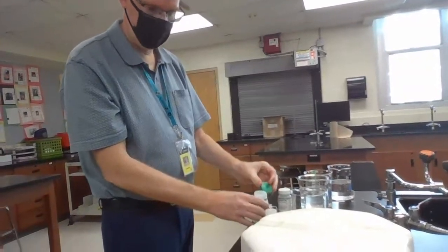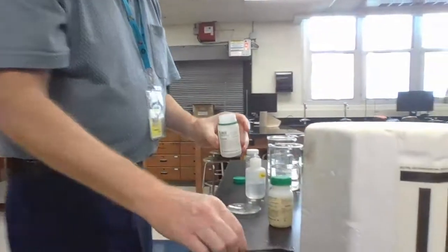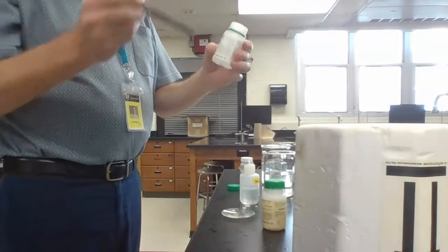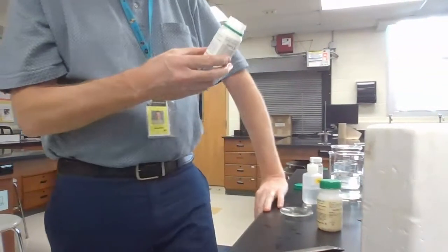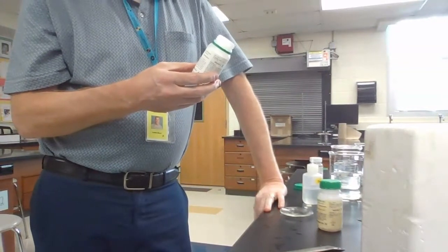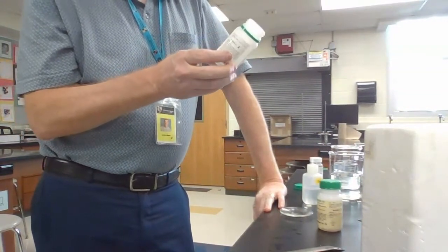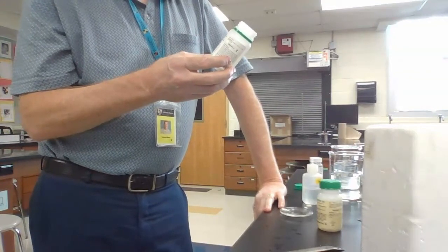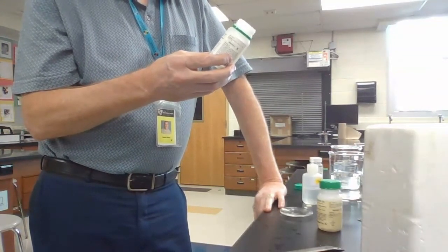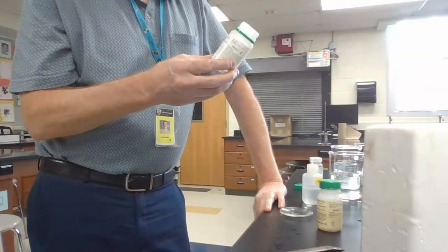All right, that was sodium. Yes. All right, I'm ready for the next one. All right, so everyone remember, pause, write your observations next to the picture of the salt shaker. Because sodium is one of the elements that makes table salt, right? Table salt is sodium chloride. So write your observations. All right, what's next?